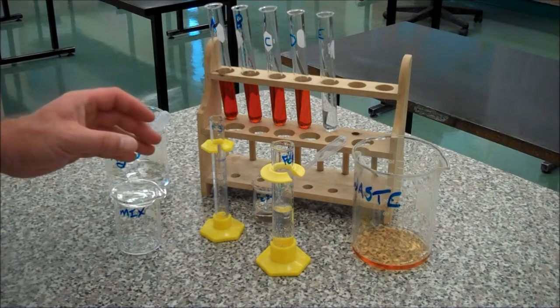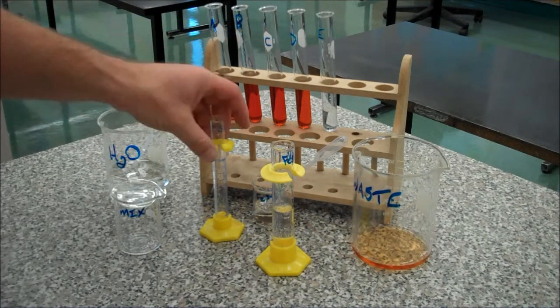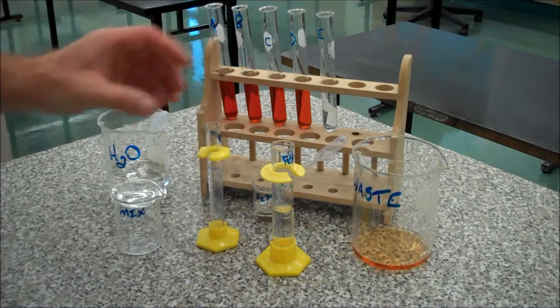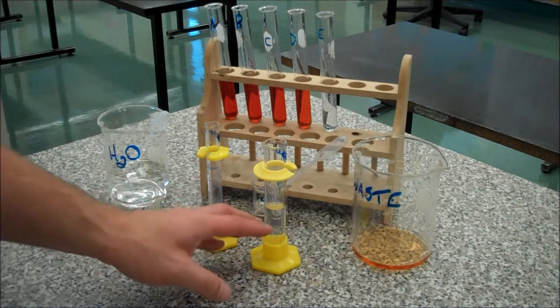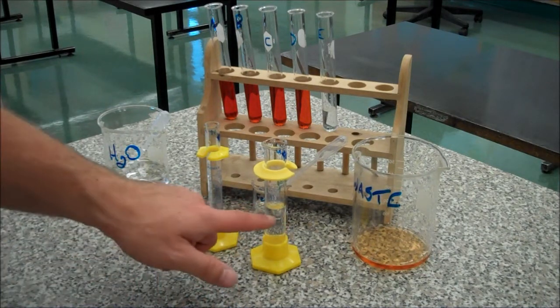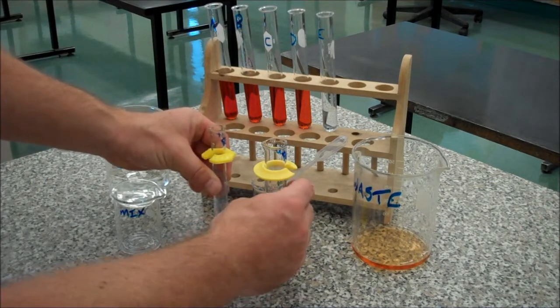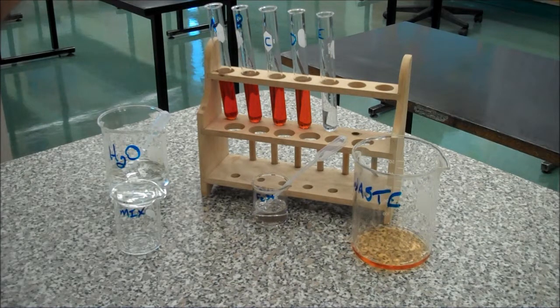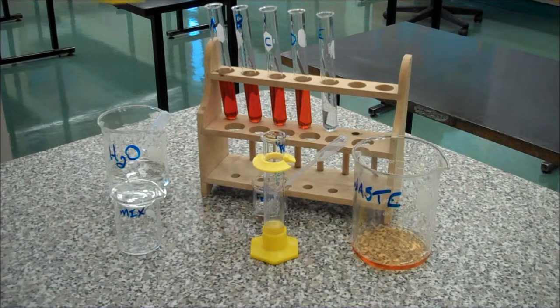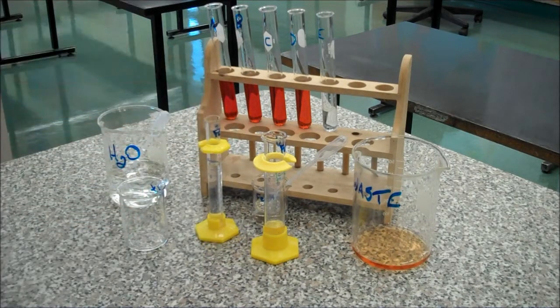Okay, I'm just on my last dilution here. I've just put my 5ml from here into test tube D. I measured the 5ml in this container, and I want to transfer 10ml into this graduated cylinder. When you're doing your successive dilutions, instead of just dumping out until you get to 10ml, I'm going to dump my 10ml into this 10ml graduated cylinder, which contained the same material a second ago — the 5ml that I transferred into test tube D.